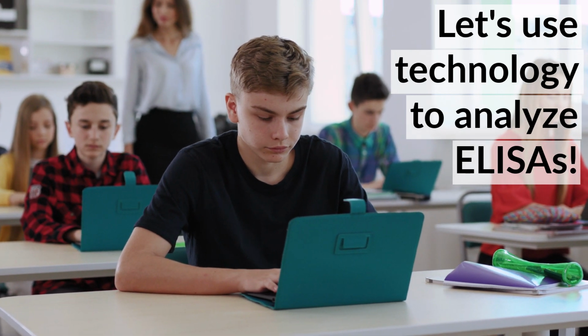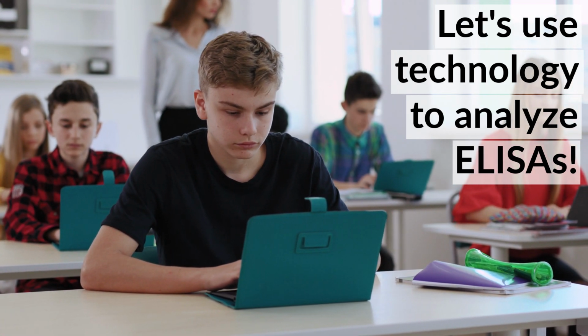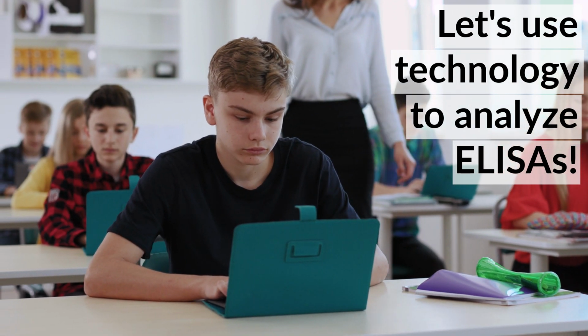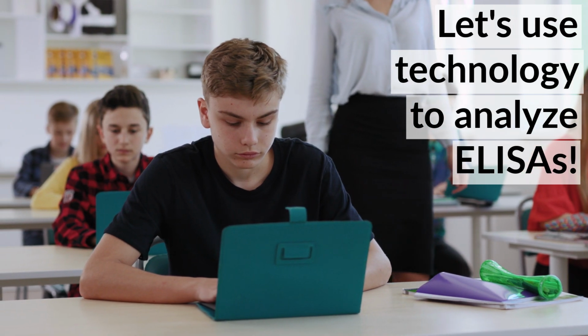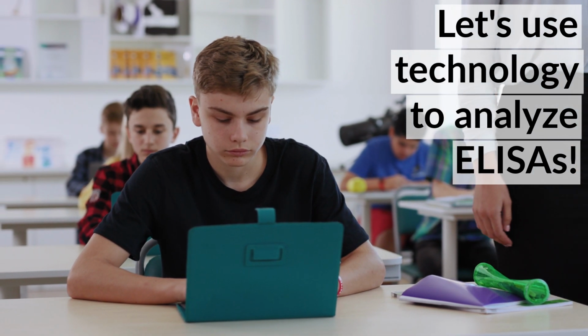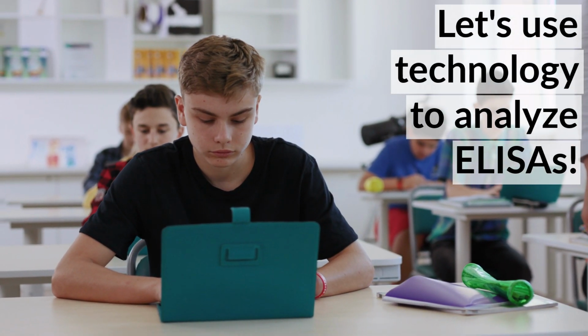And that's it! You've learned how to quantify ELISA results using simple tools you may already have in your classroom. This approach lets us relate antigen concentration to light absorption, estimating unknown sample concentrations. Let's start quantifying ELISAs the easy way.